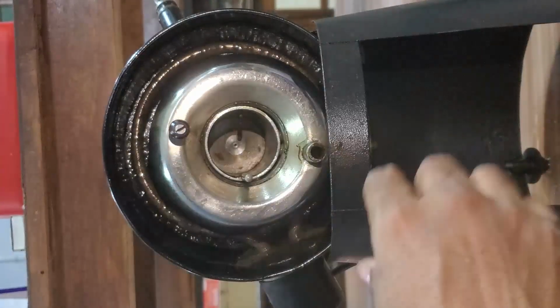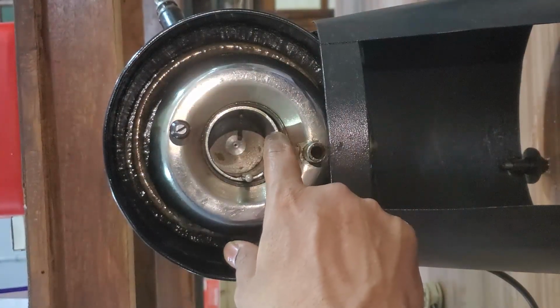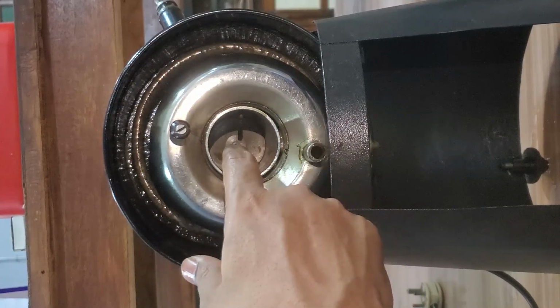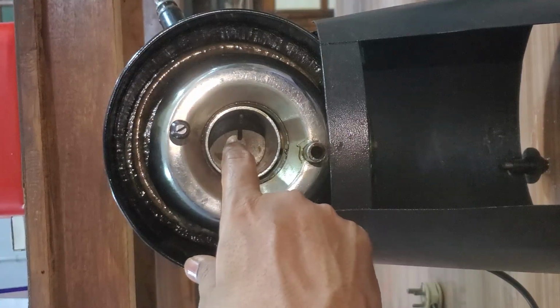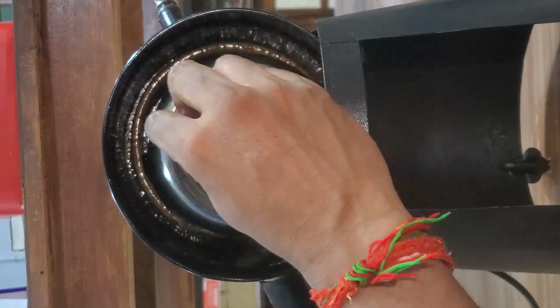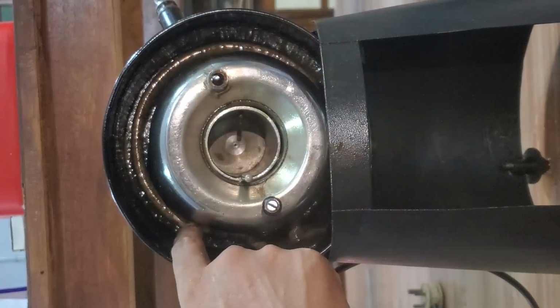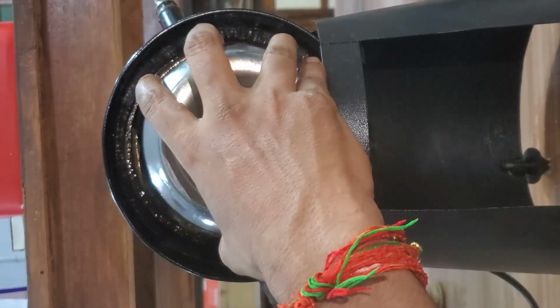So finally we can see all these parts. One is the oil cup where we are going to pour the oil, and at the center the orifice is there, through which the oil goes into the specific gravity bottle, which will be kept at the bottom of this. And the stirrer we can see. The stirrer is to make the temperature of the water uniform, because through this only the temperature will be supplied to the oil.